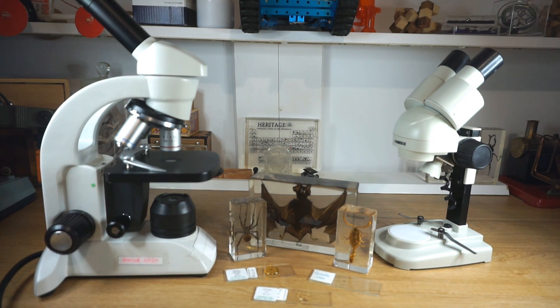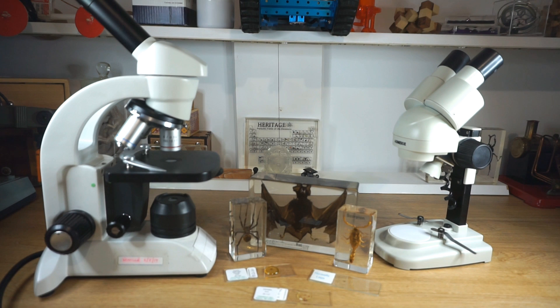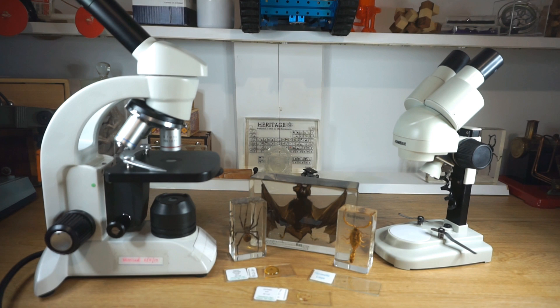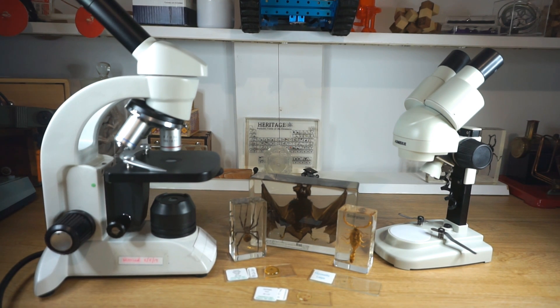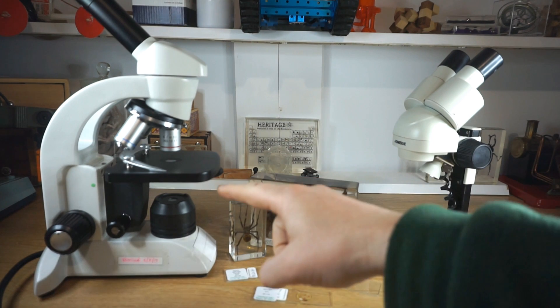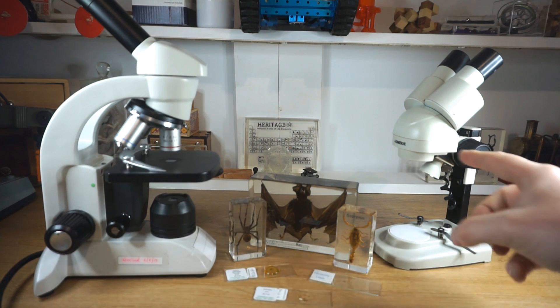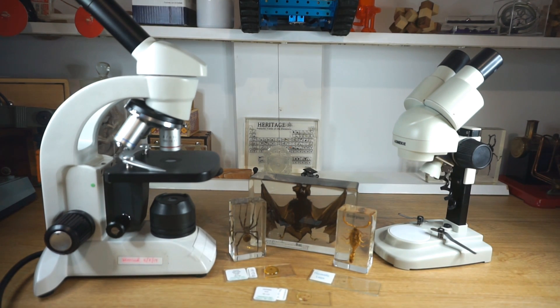Hi everyone, welcome back to High School Science 101. Today I realized that I haven't done any videos on microscopes before, even though they're such a key piece of equipment in the science lab. So today I'm going to talk you through two of the main microscopes that we use in the lab, and then show you both of them in action using some really interesting specimens. Let's get started.